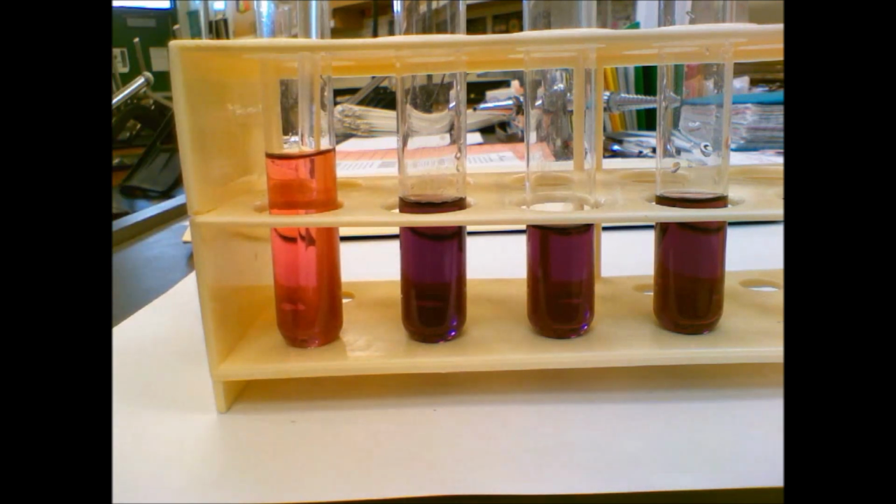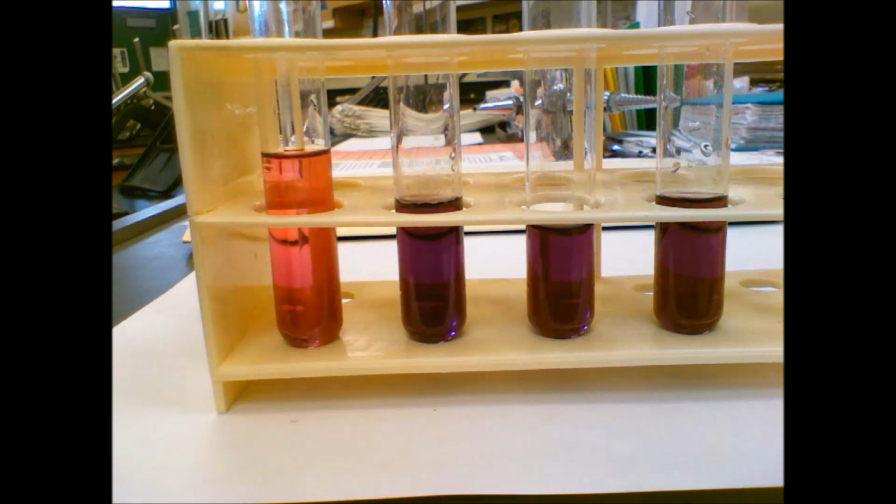product creates more reactants. All right, sorry, let me make sure we complete that row. So our initial color was purple, our final color was pink. Our shift direction, so when we say this shift direction, we want to say which direction in terms of the reaction, so left towards the reactants or right towards the products, is occurring. In this case, because we ended with a pink color and we have more reactants, it shifted to the left or towards the reactants. So you put that in that last column, to the left or towards the reactants.